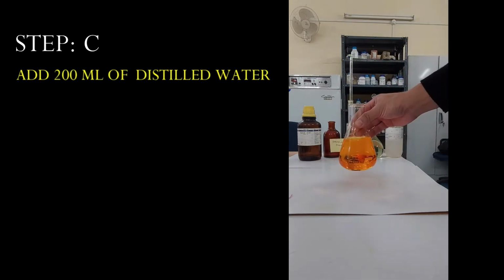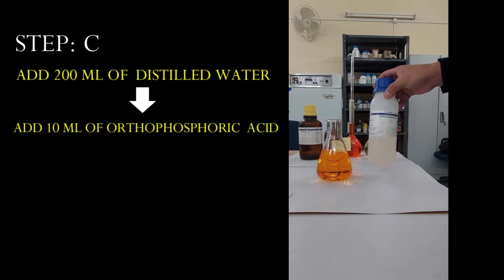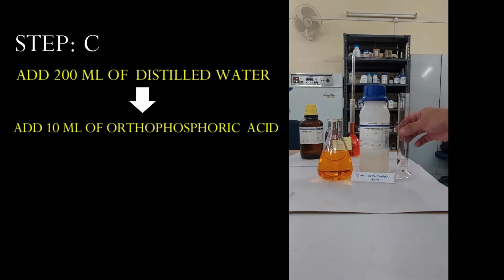Again, swirl it. And to it, again, add 10 ml of orthophosphoric acid.